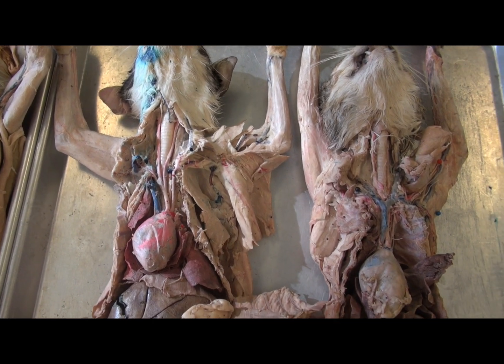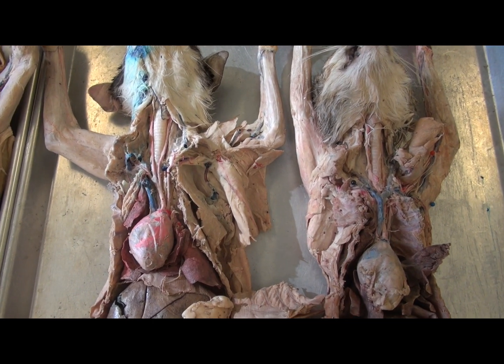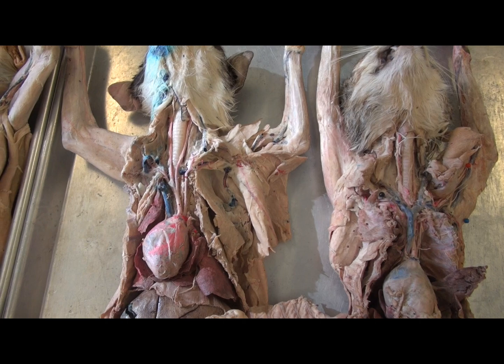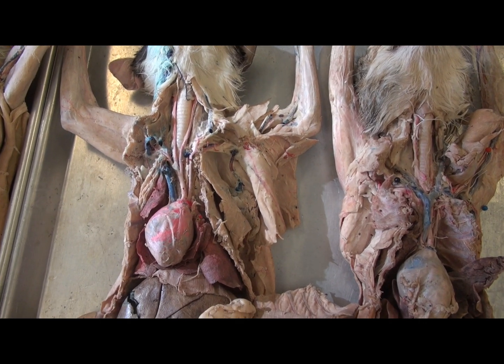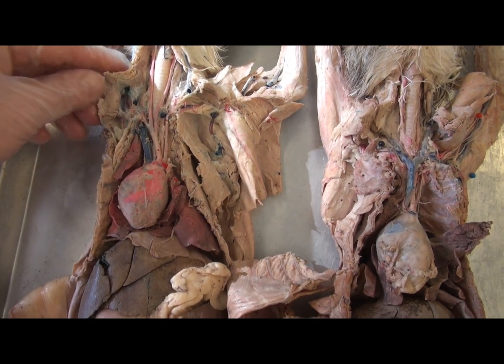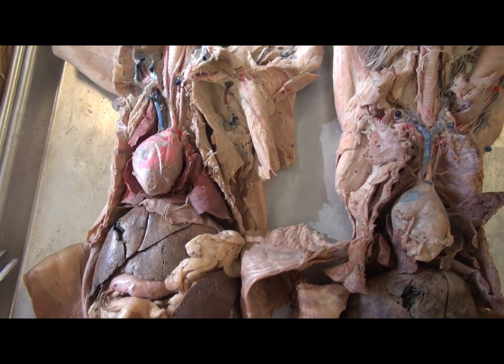This is a quick review of some of the major blood vessels in the thorax going into the arm in the cat.